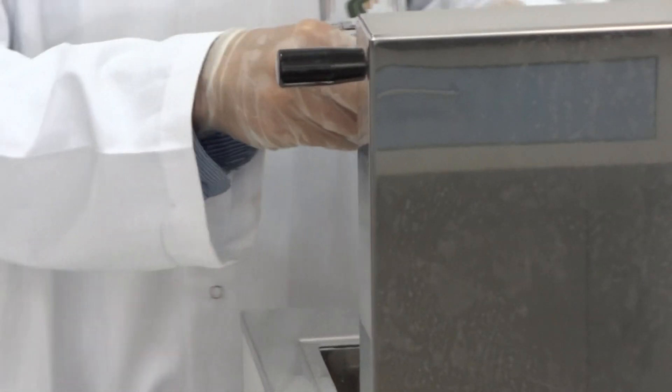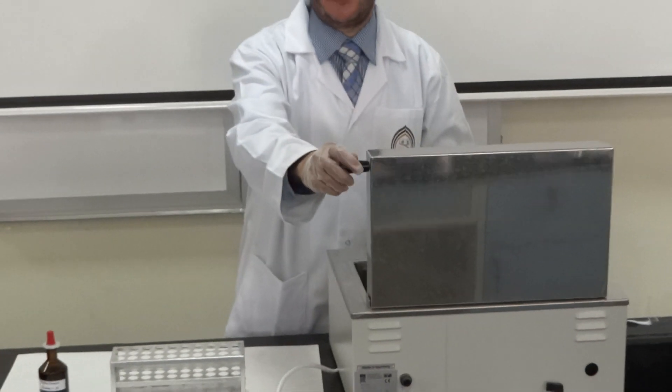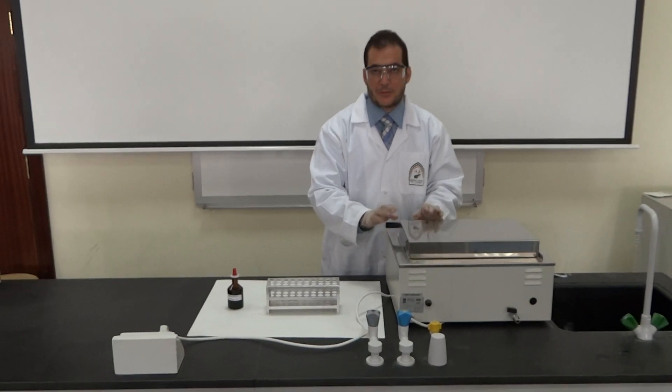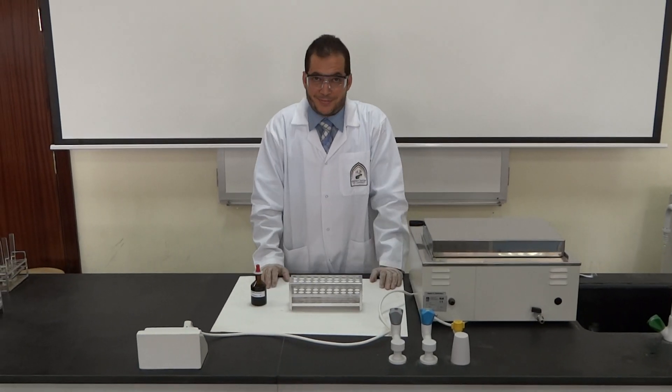The water bath, I'll leave them for a few minutes. Let's wait and see what we're going to get.